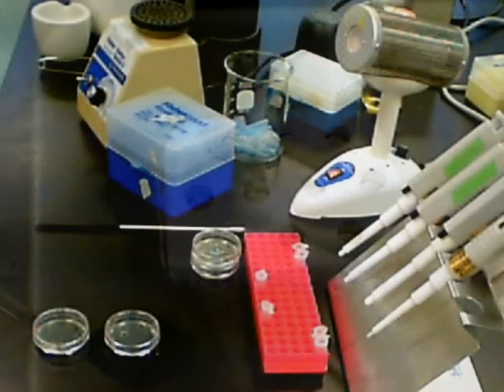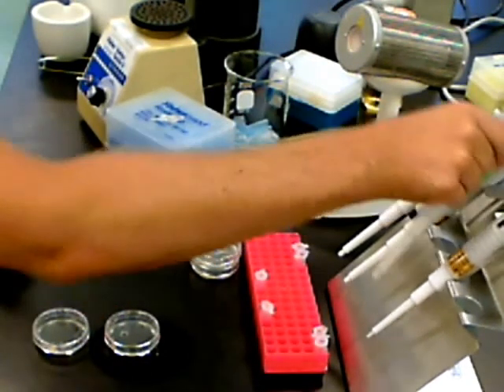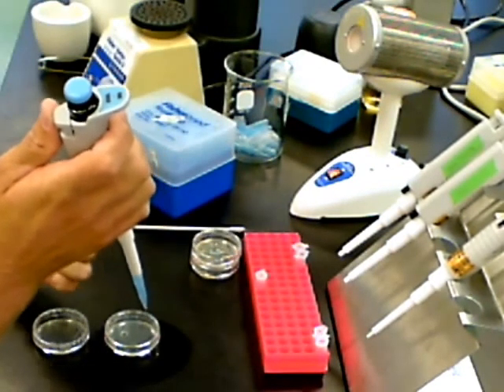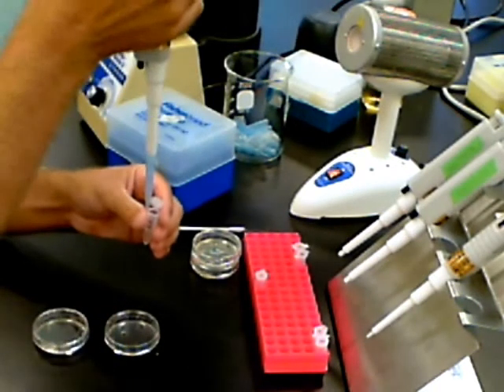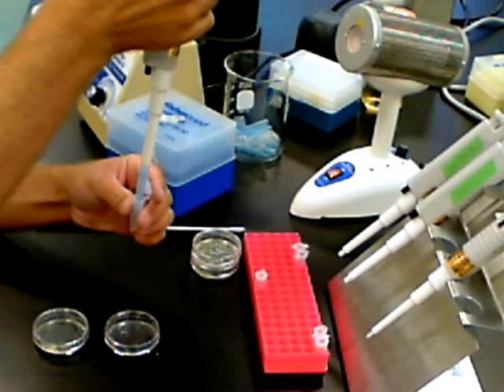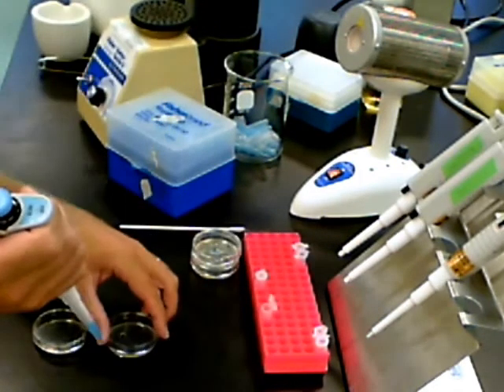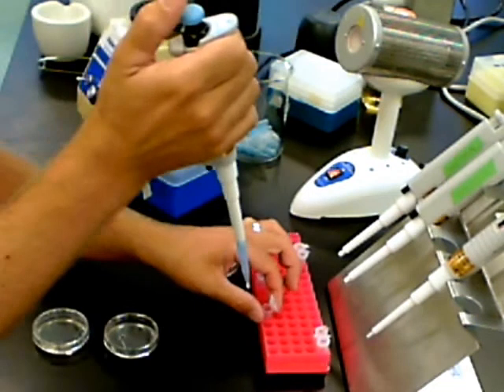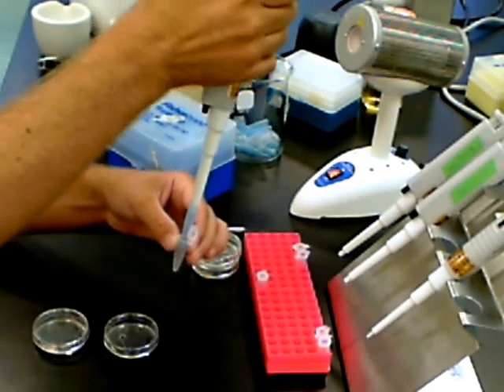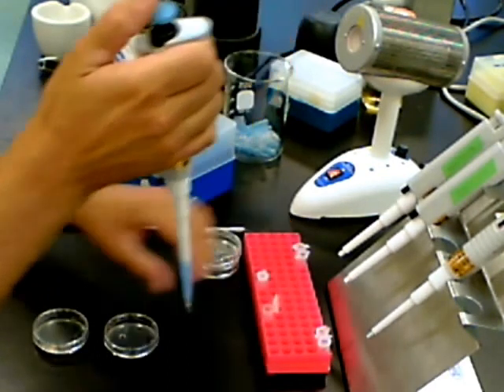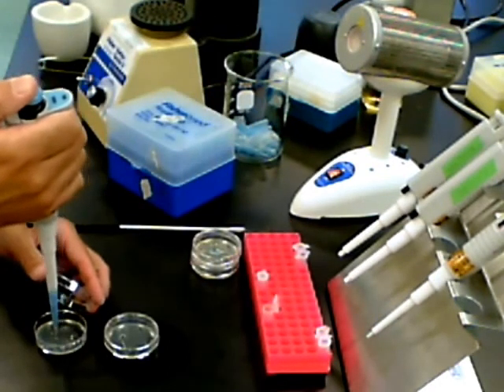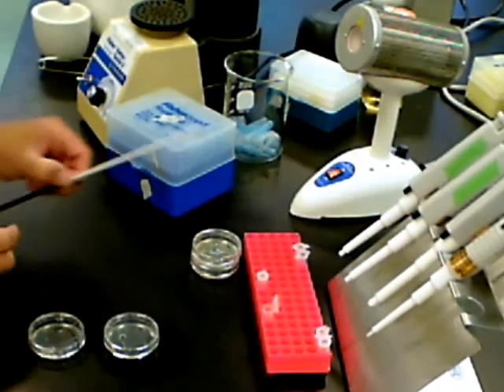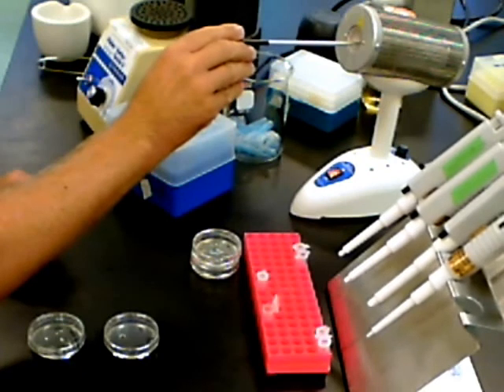The next step is to incubate the cells for 30 minutes in a 37 degrees Celsius water bath for the cells to recover. Since the DNA stretch that we are using also contains the genes for ampicillin resistance, we're going to be plating the bacterial cells onto plates that contain ampicillin and plates that do not contain ampicillin. The bacterial cells that grow on the plates containing ampicillin will also contain the gene that causes green fluorescence. So from our control tubes we'll be plating half of the medium onto the plates, and from our experimental tube we'll be plating half the medium onto the plates.